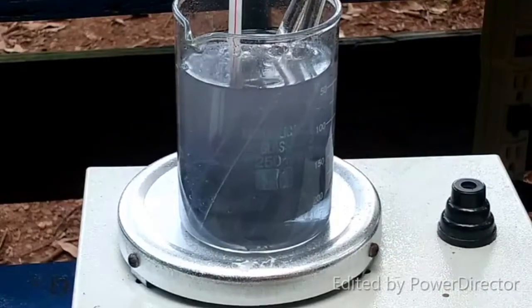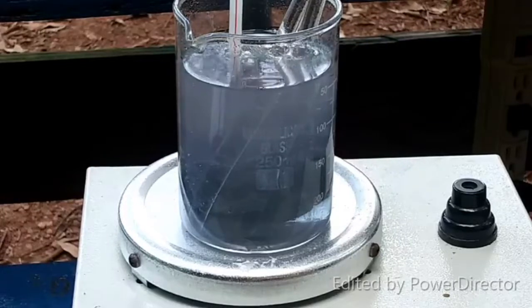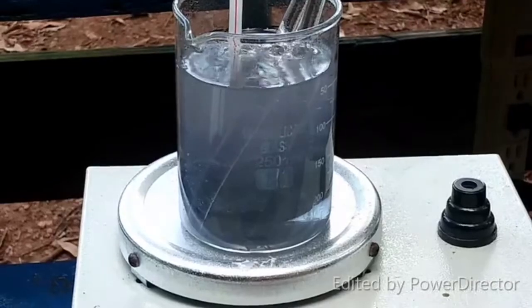I don't want to fool with it too much. But anyway, I am going to wait for it to quit producing gas — I have no idea how long that will take — but whenever it does, I will come back.